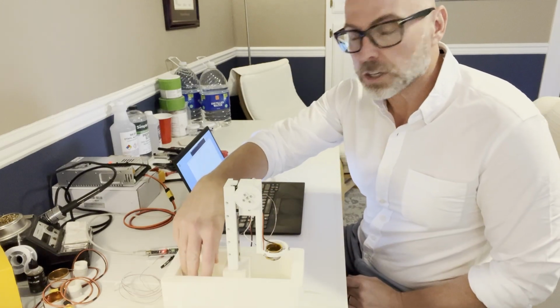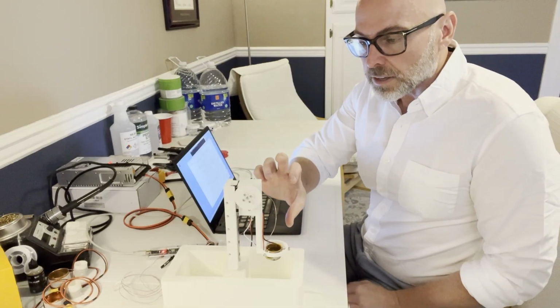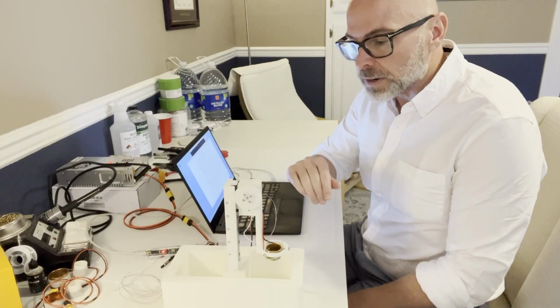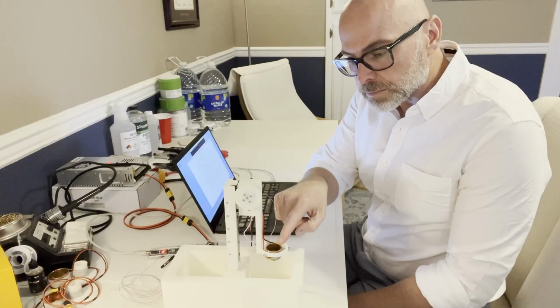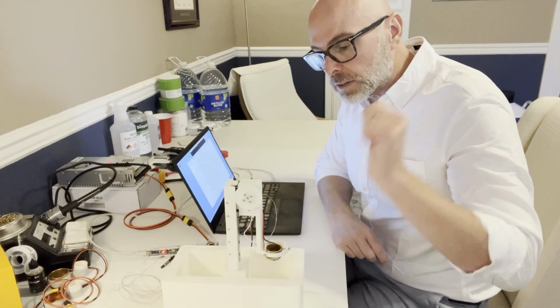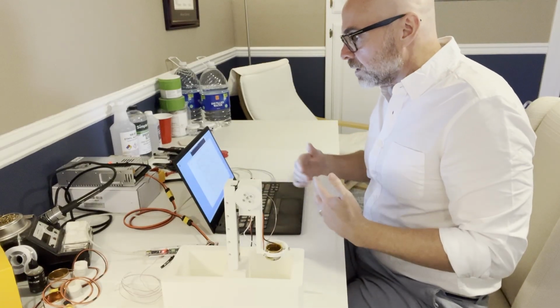So there's a big chunk of ice in here. This can lower down and raise, and so it could plunge it into that ice water, but will be liquid nitrogen. And then there's nichrome wire wrapped around this little well here, and that's where the specimens will go in. Okay, and then there's a whole setup to capture that data and whatnot.